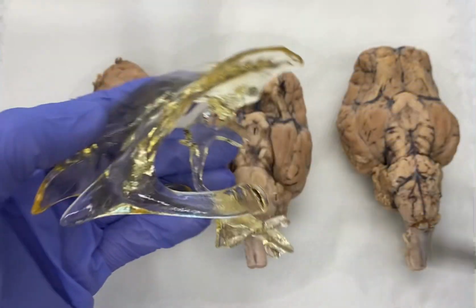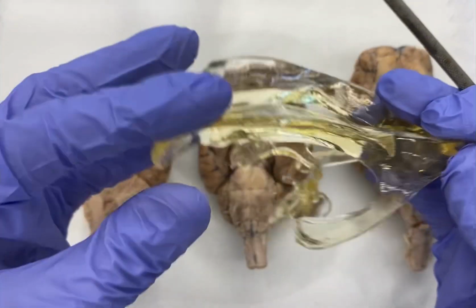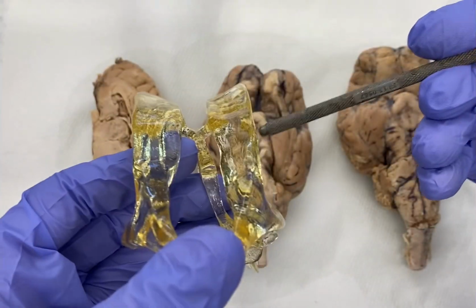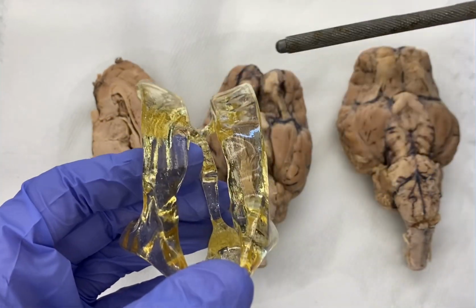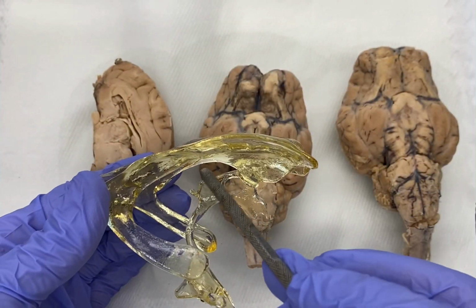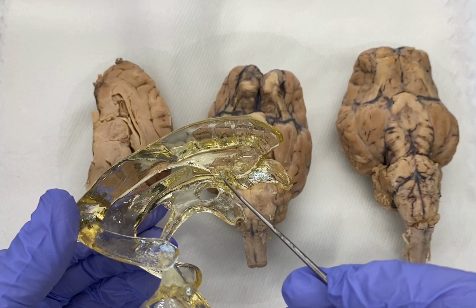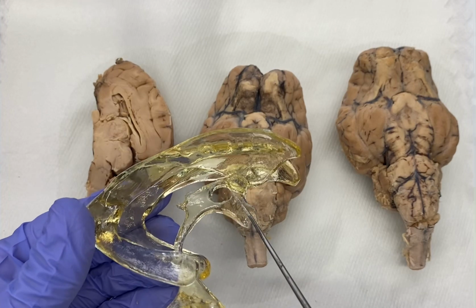So these are our lateral ventricles, right? This large one here makes this C shape. There's one on one side in one hemisphere, and another in our other hemisphere. Importantly, don't call these ventricle 1 and ventricle 2. Just call them lateral. We said from our lateral ventricle, we go to our third, which is this one here with this opening here. To get there, you go through this little opening called the interventricular foramen, which you can kind of see here. That allows the CSF to go from lateral to the third ventricle.